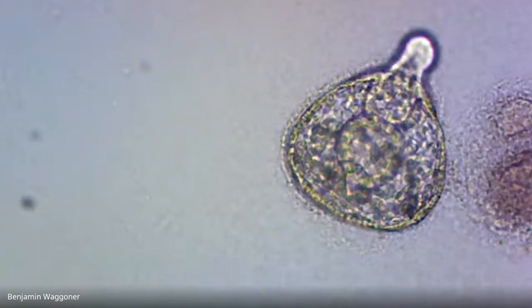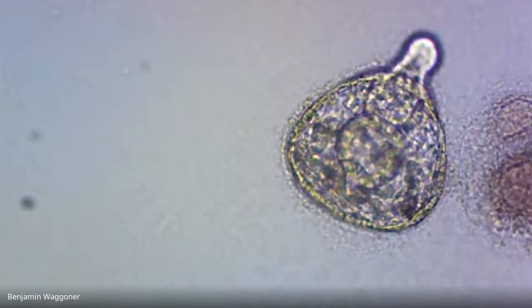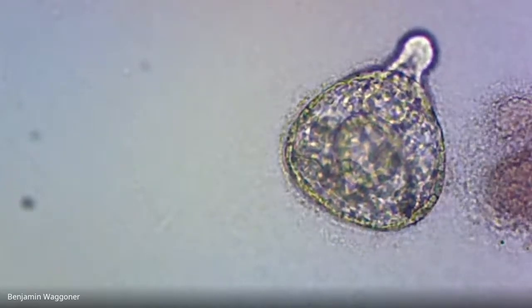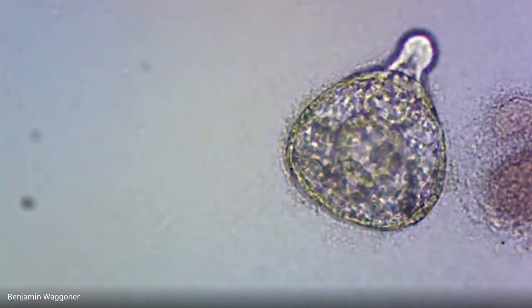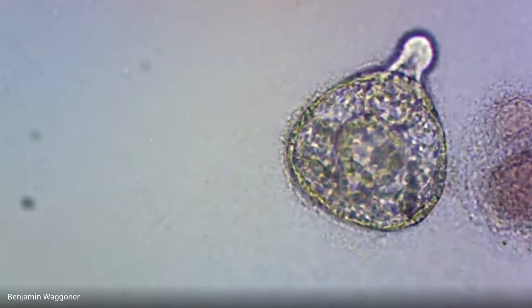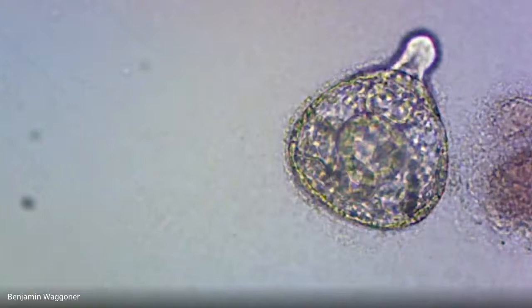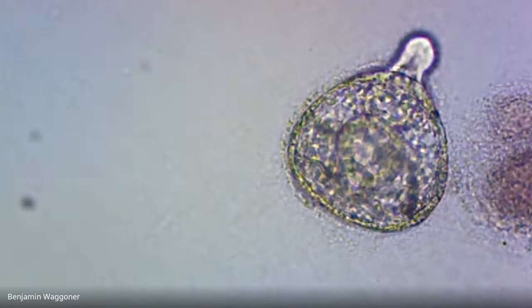Okay, hey, I might have to take that back. It may actually be trying to break out of the vitelline or fertilization membrane that's been surrounding it all this time, because I think I saw it make a muscle contraction just a minute ago. Let's see if it does it again. Yeah, I think it's doing it. I'm not touching the focus knob right now, so any movement that you see is the embryo doing it itself.